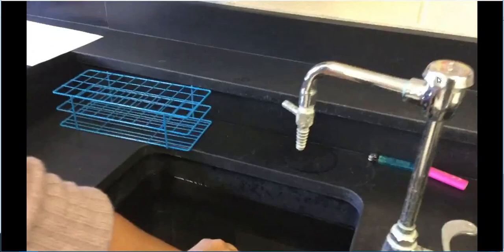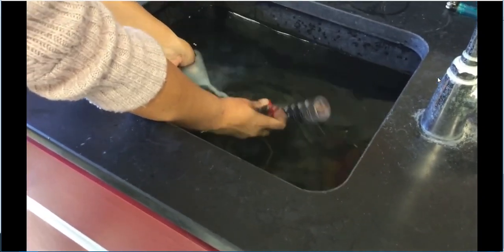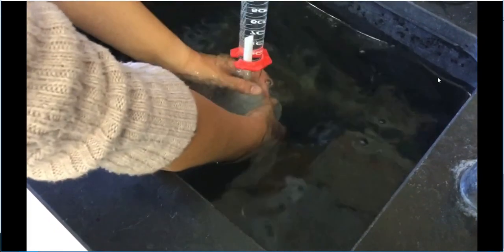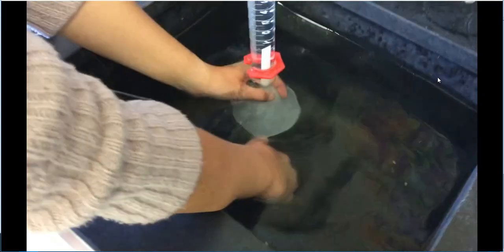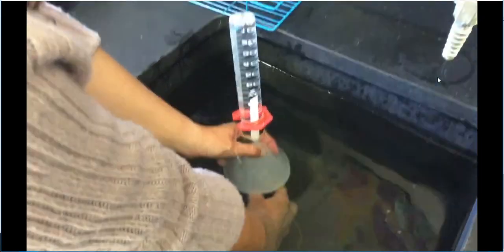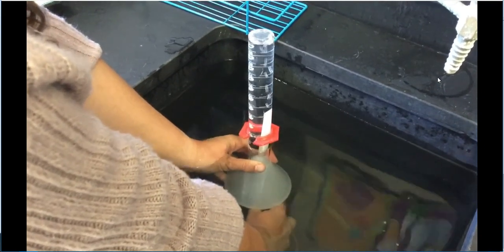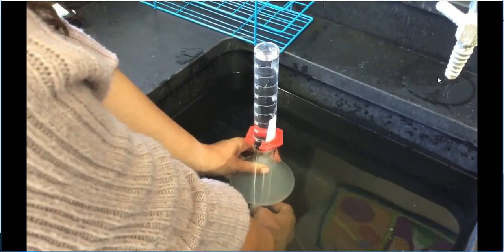So we're going to go ahead and fill this up all the way to the top. I'm going to carefully put my funnel in there. And that way, we aren't letting any air in. Let's switch my hands with the lighter. There we go. All right, so now what I'm going to do is I'm going to go ahead and push this lever. That 13.92 was our initial. So now we're just going to collect the gas. So you can kind of see the bubbles that are going into this tube. So this is a very long process.